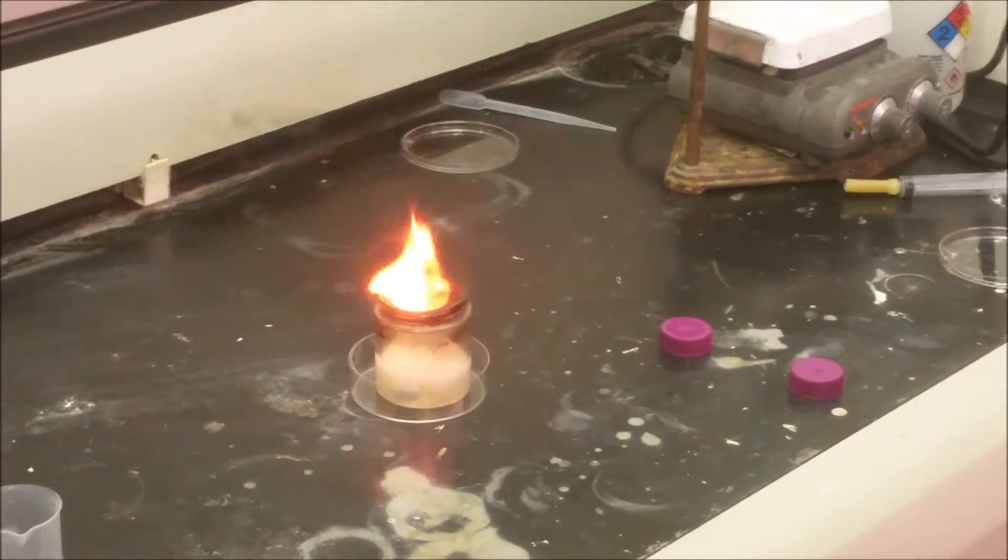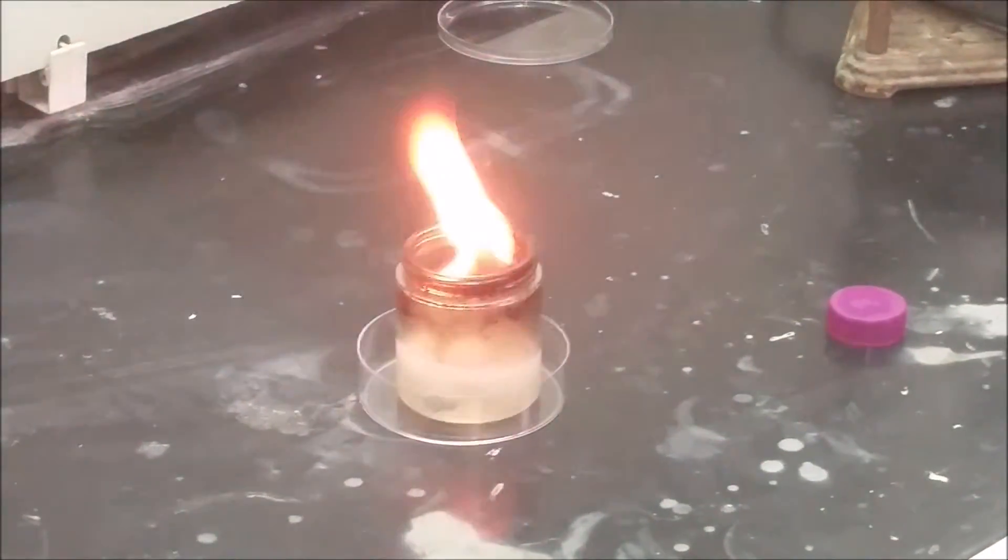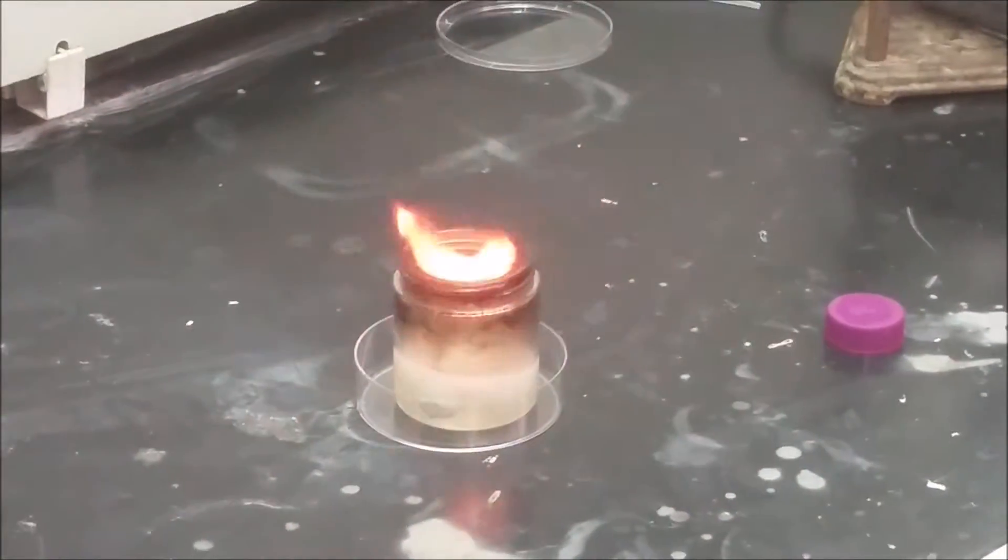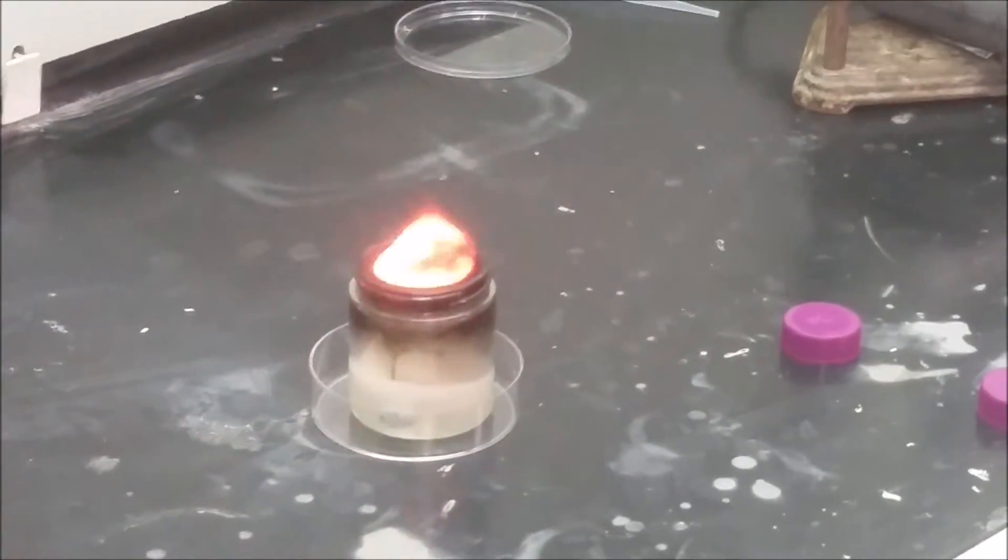The fire you see coming off of there now is not acetylene burning in oxygen, but rather acetylene burning in chlorine. It's a very dangerous reaction. You should absolutely never try this.